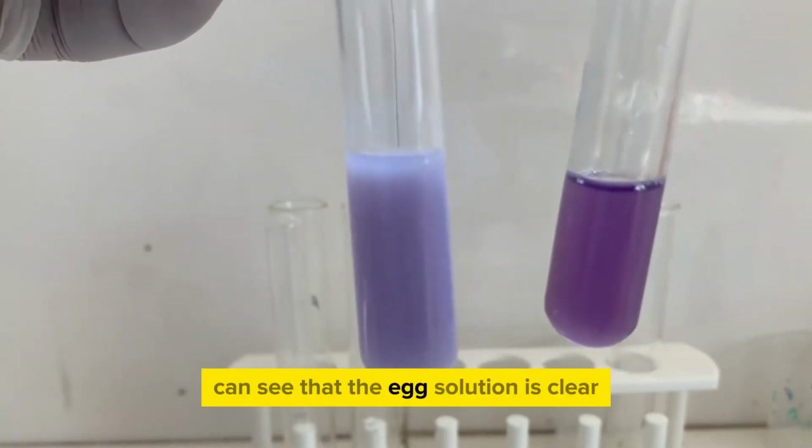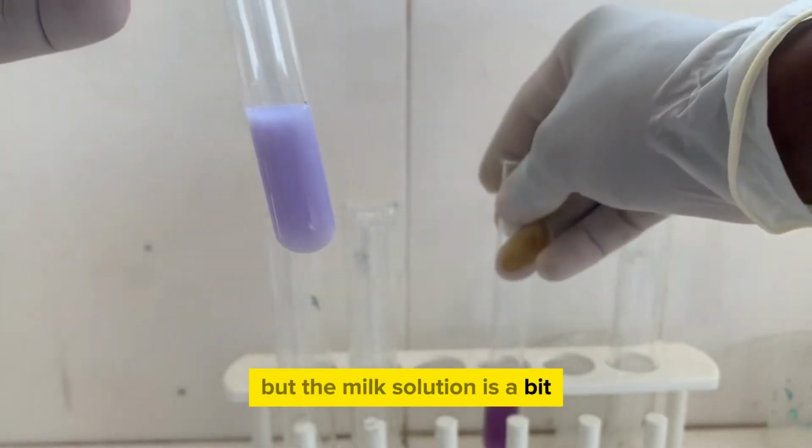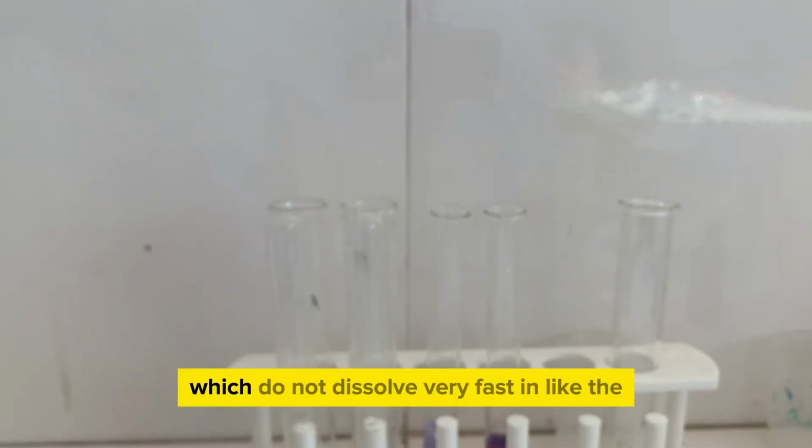You can see here that the egg solution is clearer, but the milk solution is a bit obscure, looks like a suspension. That's because milk contains a lot of minerals like calcium, which do not dissolve very fast, unlike the proteins which are present in the egg solution.